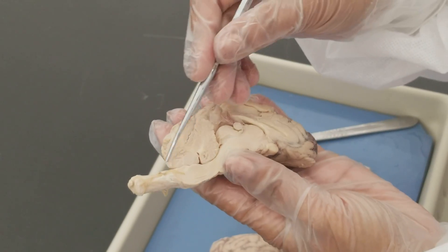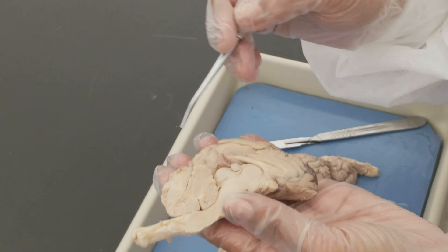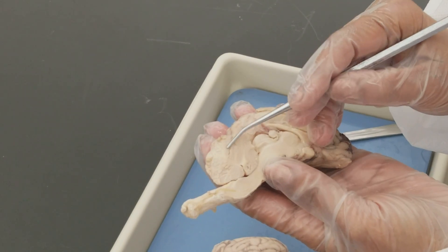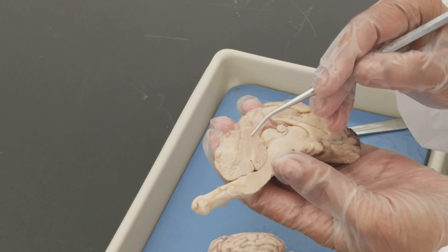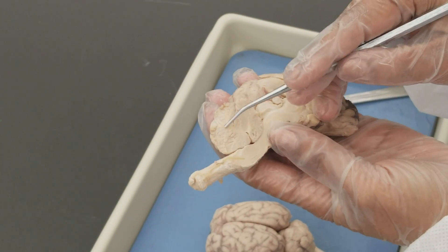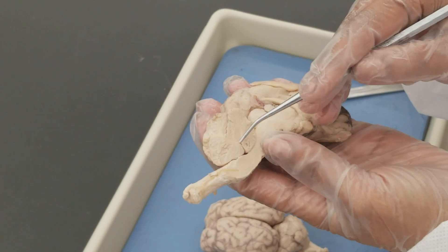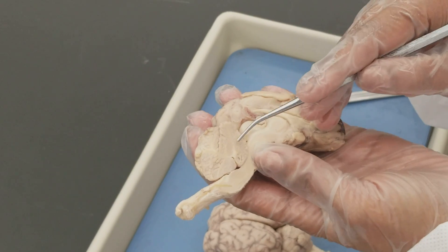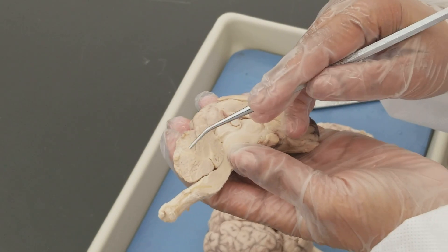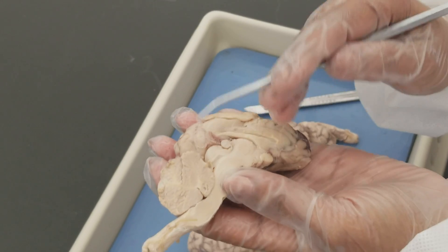This region is the cerebellum — the small brain. You can see the dark and light areas: the dark areas are the gray matter, and the white area is the white matter of the cerebellum. This white matter is called the arbor vitae, meaning tree of life, because of its resemblance to a small tree.